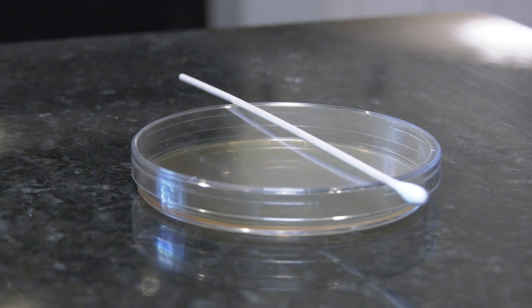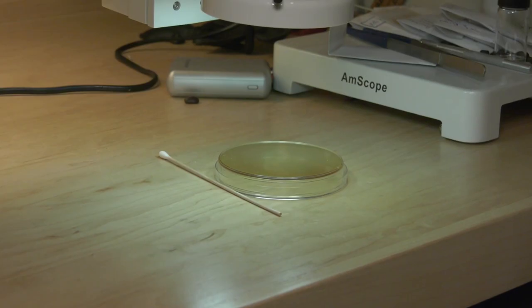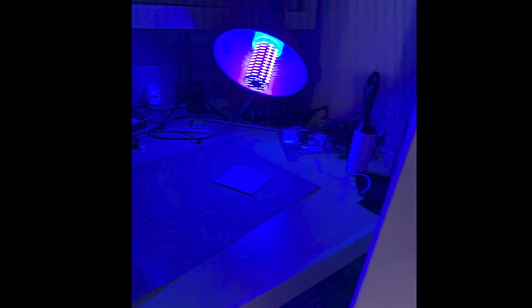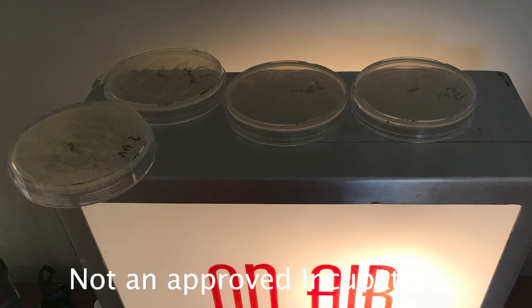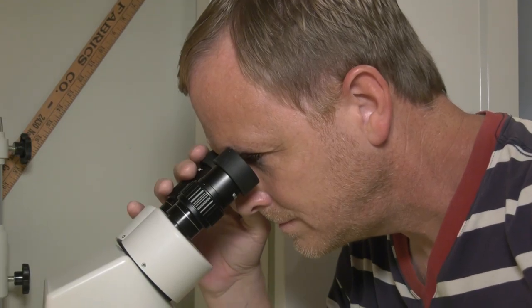Back to my experiment now. I went online and I got a couple of these things. This is a UVC sterilizer light that plugs into your basic light socket — it's an LED light. Here's how I tested it: I grabbed a couple of petri dishes. I inoculated bacteria on the first dish to use as a control, then I did the same on the second dish. This time I exposed it to the UV light for a few minutes. I stuck them in my incubator for a few days to see what happened. And, ready for this?